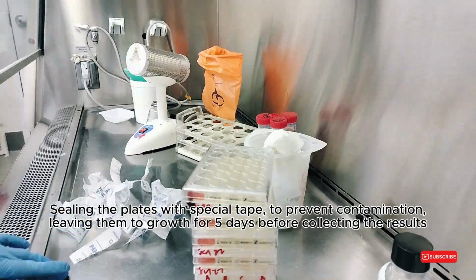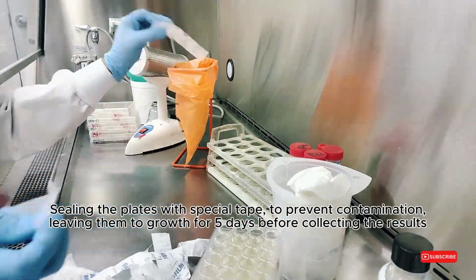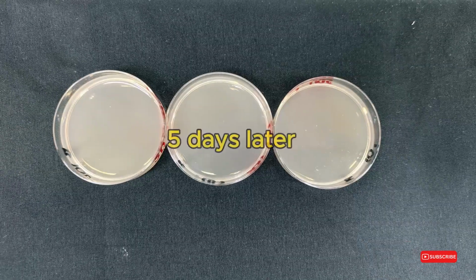Sealing the plates with special tape to prevent contamination, leaving them to grow for 5 days before collecting the results. 5 days later.